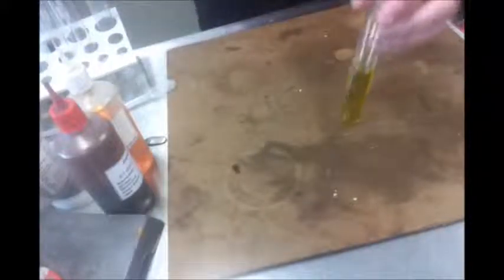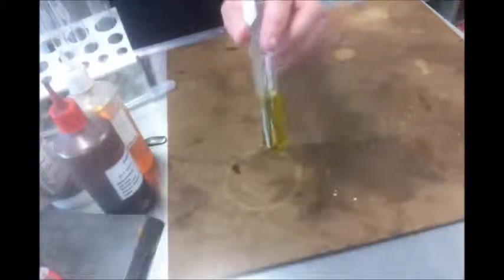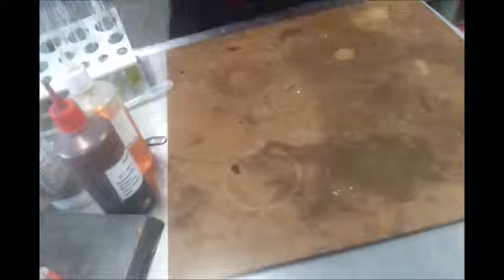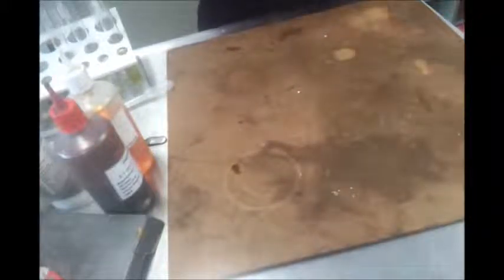I'm going to find something white to put behind that to show that it's not yellow. Okay, it's got a bit of a green tinge to it. So in that we can see that in our table on page 56 dichromate Cr2O7 2 negative is paired up with chromium 3, which is indeed, it should say green or blue-green.